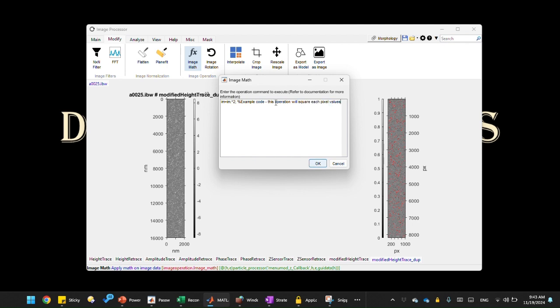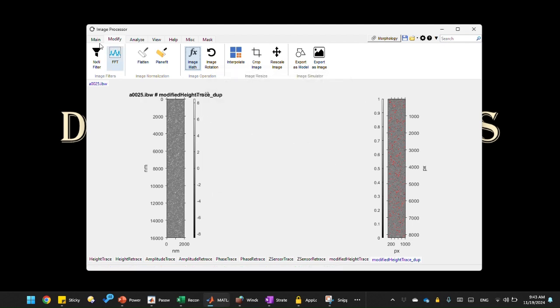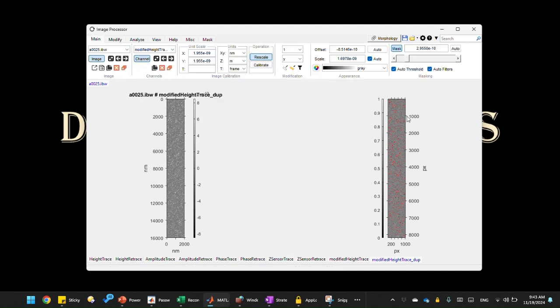Now we need to modify this to make our mask image, which is essentially a binary image, where 0 represents the unmasked area and 1 represents the masked area. We need to create a binary image for a mask image. Now, to create a mask, we need to know our mask threshold. So let's go back and check on the mask threshold that we're going to use.